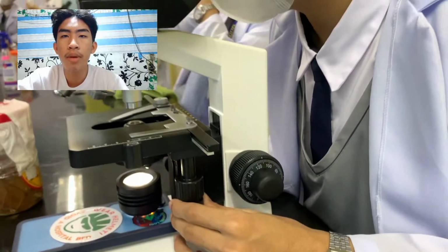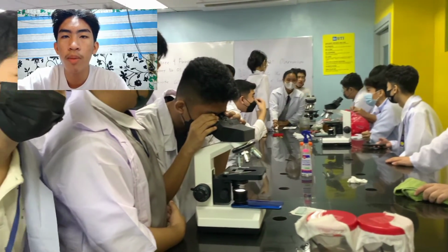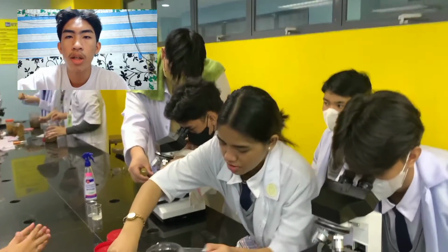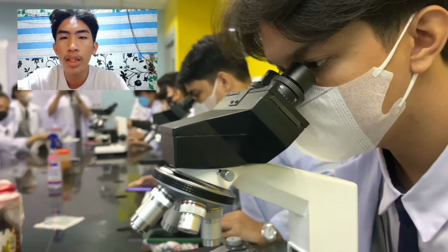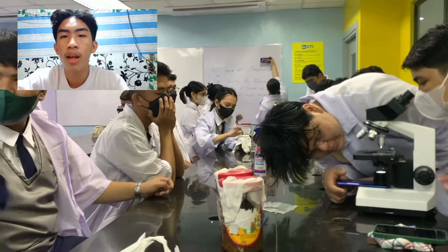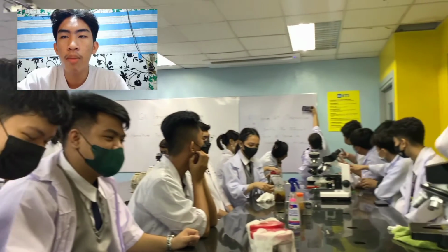Most organisms can be observed at a magnification of 200 times, and after 2 or more weeks you will need a microscope to observe the protists, utilizing either a dropper or a toothpick to extract the drop of water. Subsequently, be careful to drop the water on a microscope slide. Afterward, drop the cover slip and adjust the lens and stage of the microscope to observe the protists. Use a 10 times to 40 times zoom lens to see the protists moving inside the droplet.